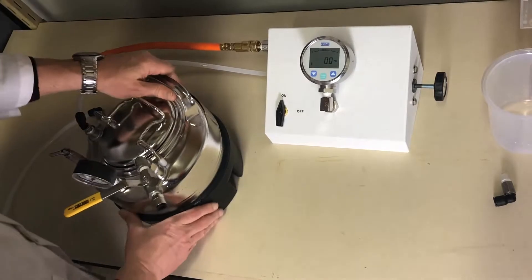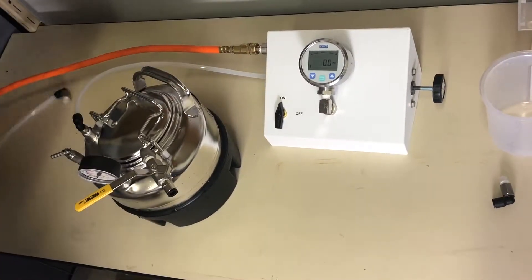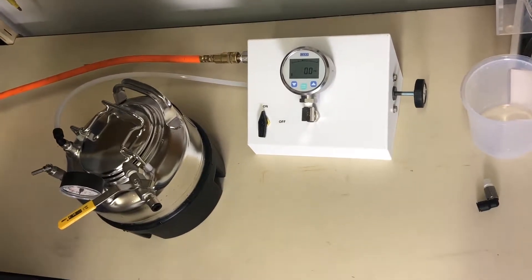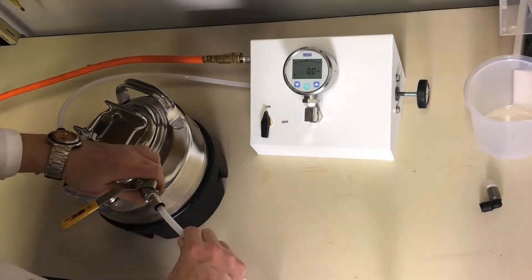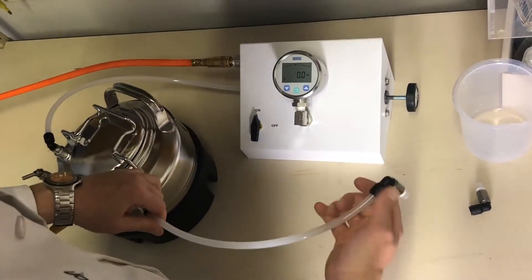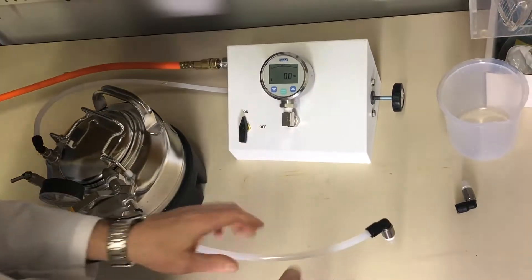Can you still see it? Yes! I should have connected this earlier, but that's alright. So we'll connect the outlet tubing to the pressure pot, and here's where the fun begins.